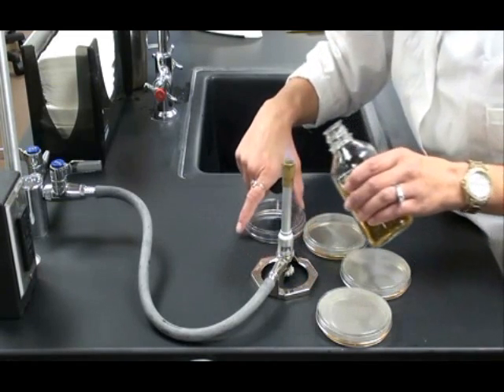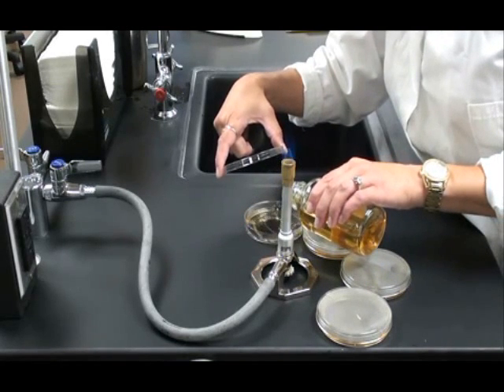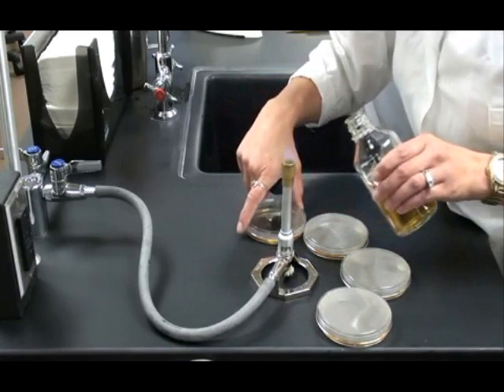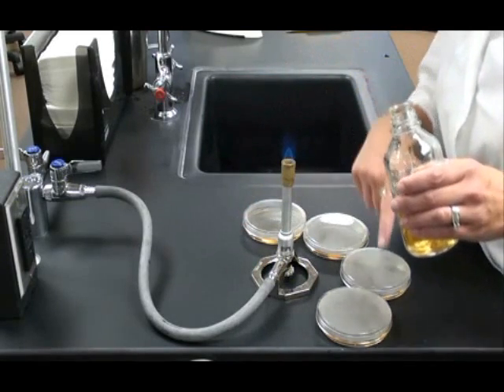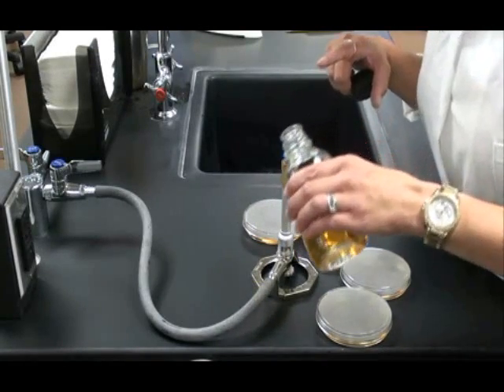So again, after pouring three or four, I would want to re-sterilize the neck of that bottle if I were going to pour more. I'm done. I'm only going to pour four in this video, so I'm going to sterilize the neck of the bottle and recap the bottle.